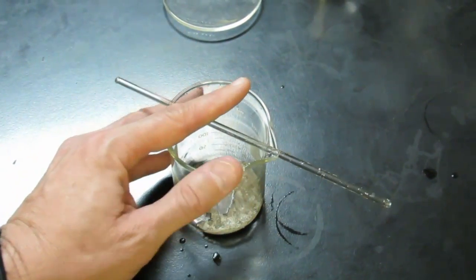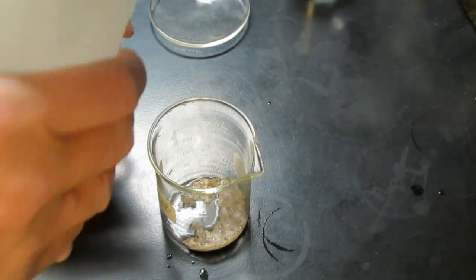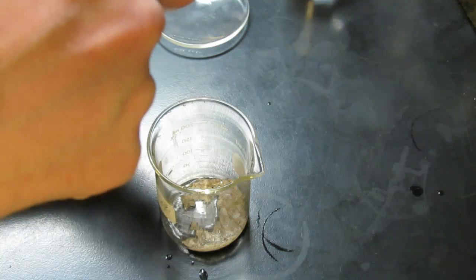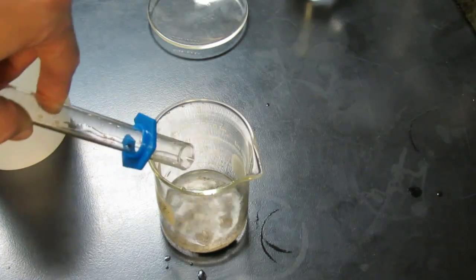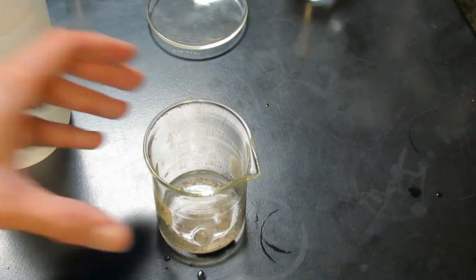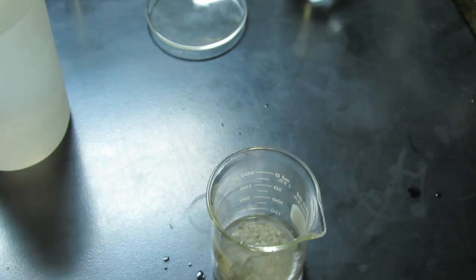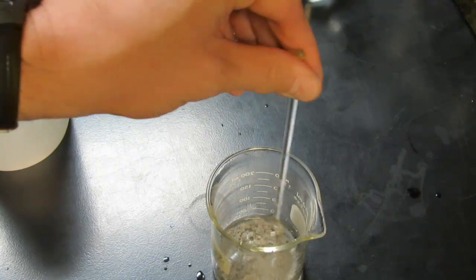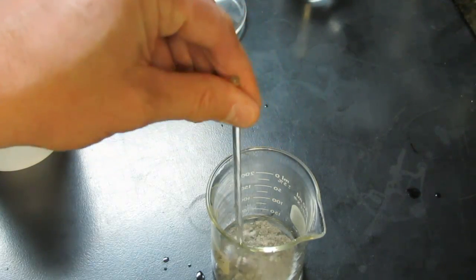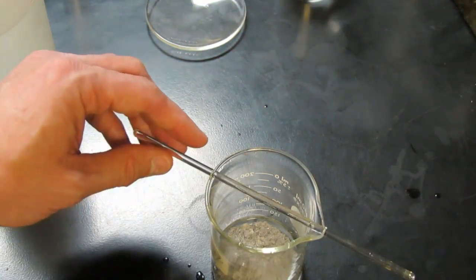Now we want to rinse that silver. So our next step is to rinse it with distilled water. We're going to add an aliquot of distilled water, about 10 mils. Once again it could be a little more, a little less. We'll add that to the silver. Swirl that around a little bit. We're trying to rinse any residue that might be on our flakes of silver. You're going to get your stirring rod and you'll mix it up ever so gently. We don't want to mix it up too much because we're going to decant that water here next.